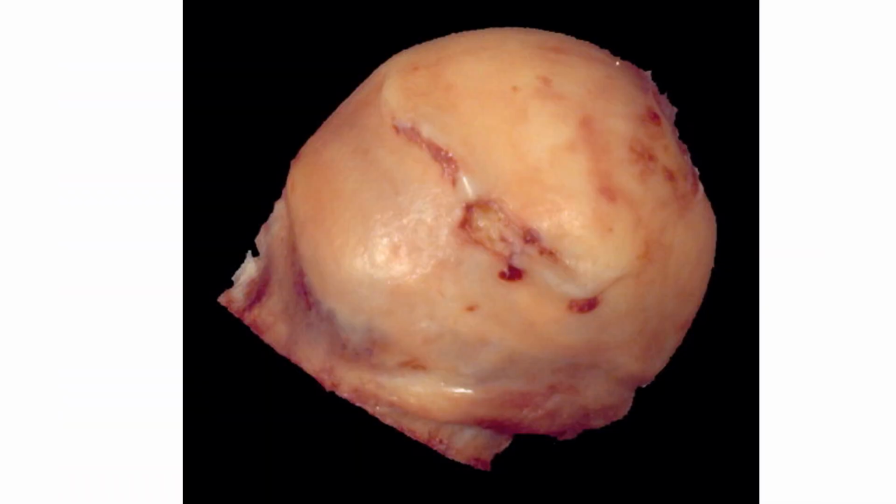Next is osteoarthritis. This is the head of the femur of a patient with osteoarthritis. You can see that the surface of the head of the femur is very granular, and in areas you can see almost an ulceration, meaning that there's loss of cartilage lining, and some areas of the cartilage become so shiny, right? So shiny, this is what we call eburnation of the cartilage surface, and because of loss of the cartilage lining, you can see exposure of the bony surface there.